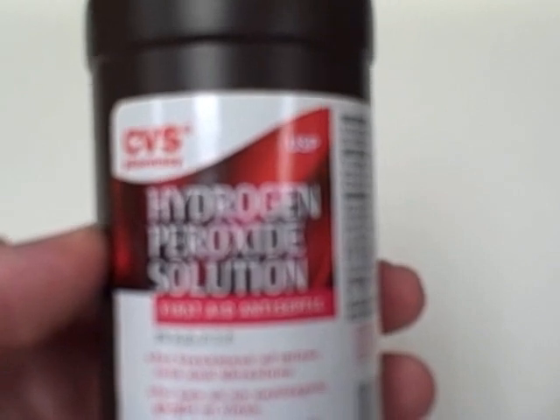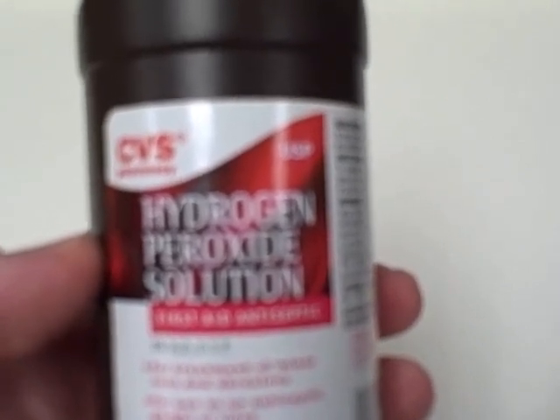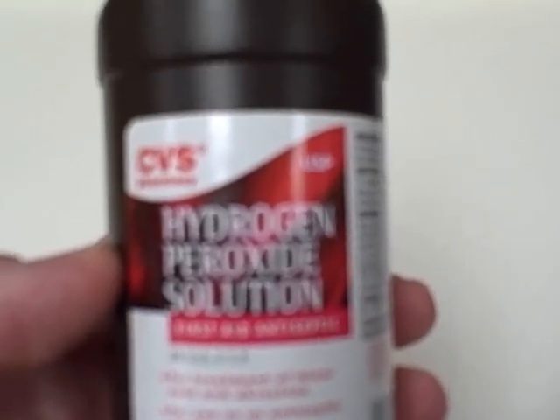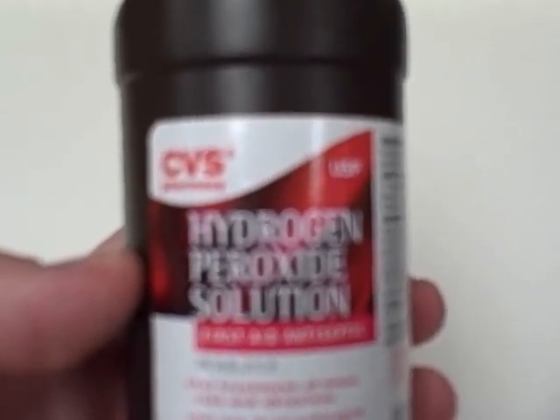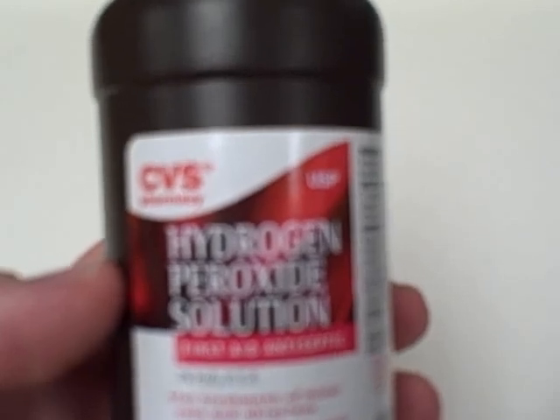Most people are familiar with hydrogen peroxide solution that can be purchased at your local drugstore. It's used to disinfect minor cuts and scrapes. Sometimes if you use it on a scrape or cut that's too deep though, it tends to sting quite a bit.